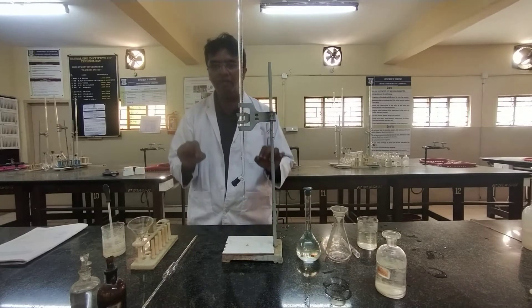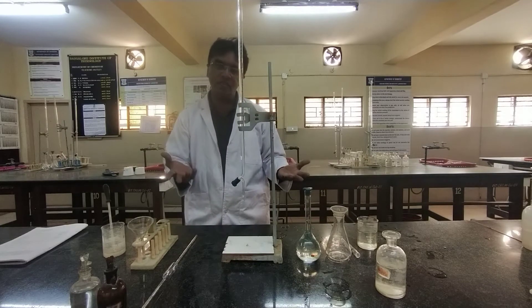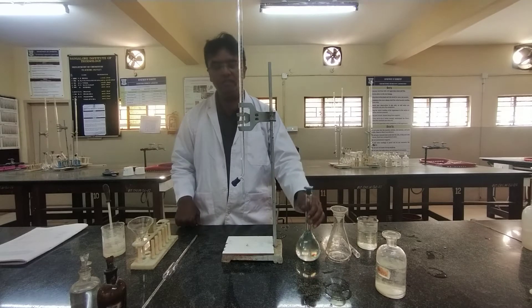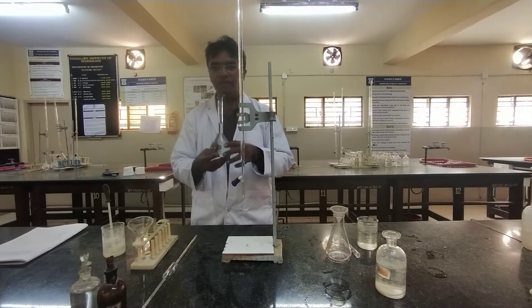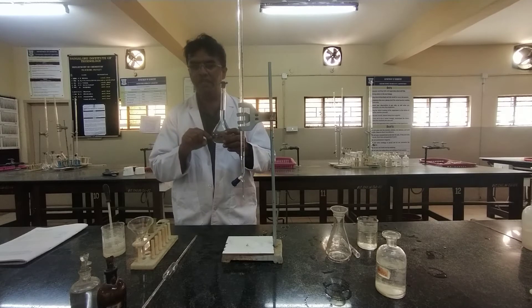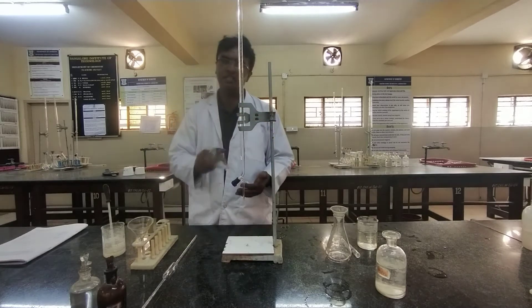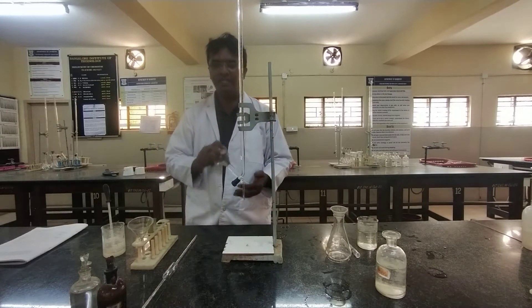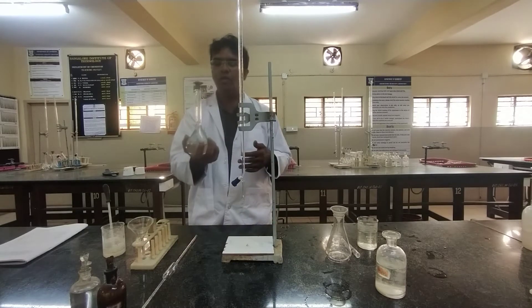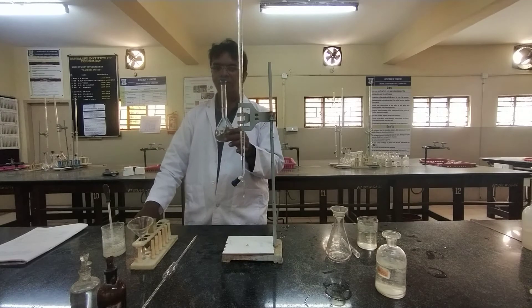Every one of you will be given a certain known amount of the brass solution — one may be given 10 ml, another 12 ml, and so on. You take the given volume, for example 10 ml, into the volumetric flask, add water up to the mark, close the lid, and shake for uniform concentration. This is how we dilute the concentrated brass solution to 250 cm³. You can see it is slightly bluish in color because copper salts are generally blue.